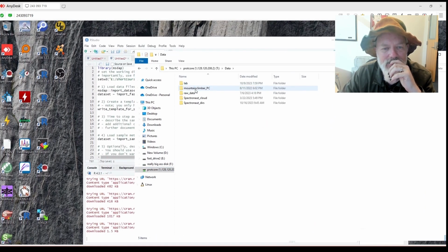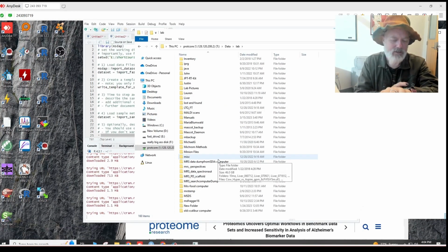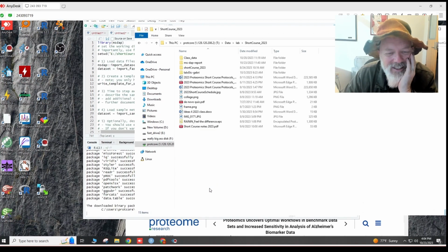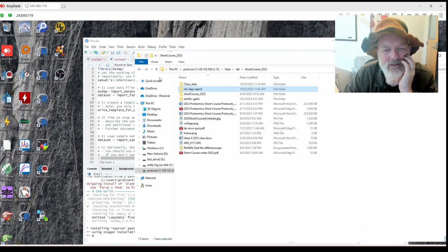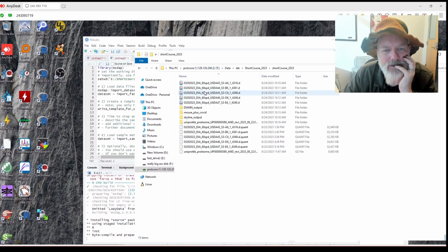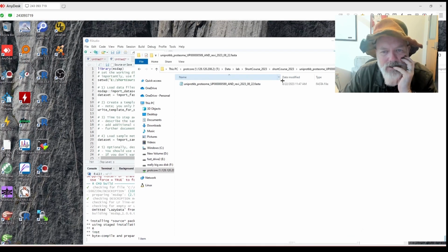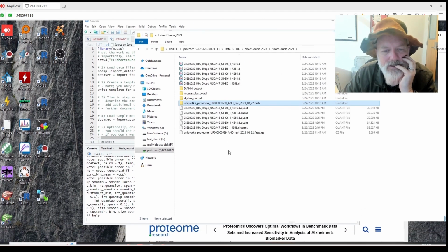It'll also ask you for the FASTA files you used. And I think I have that. Okay, I think I have that right here. Short course 2023. You see, we've been doing this for a long time. So this is 2008. So let's see, MS DAP report. I don't have, let's see, the FASTAs. I thought I put them there, but I didn't. Oh, maybe I did put them here. Let's see. Is that it? Yes. So I use this one. And reverse. That's not what I did. That was for something else.